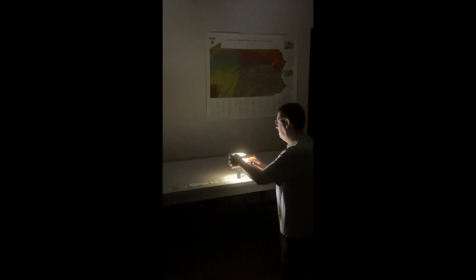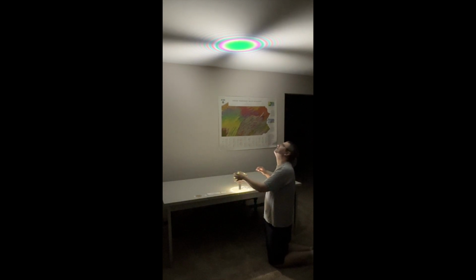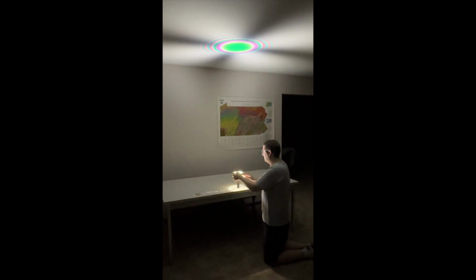and we're going to switch over to our next sample, which is our natural quartz slice. Quartz, like corundum, is actually uniaxial. However, it has a special power that corundum does not, called optical activity, and so it actually ends up generating an interference figure with this distinctive circle at the center. If you can generate this interference figure for a material, that material is almost certainly quartz. There's only a couple other options it could be, and they're all very rare.